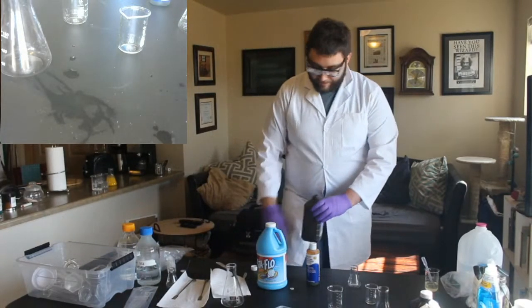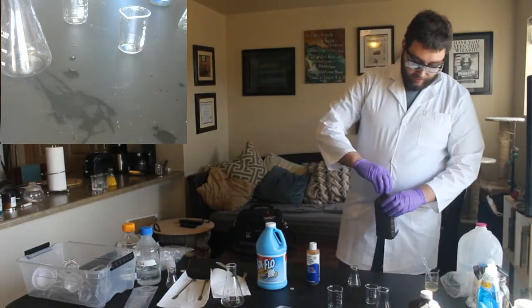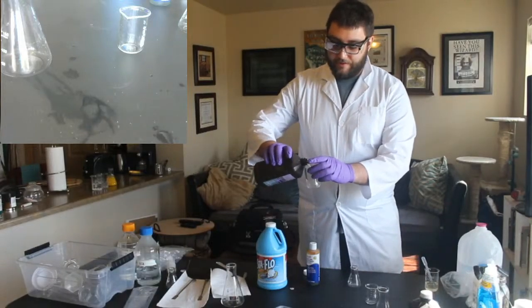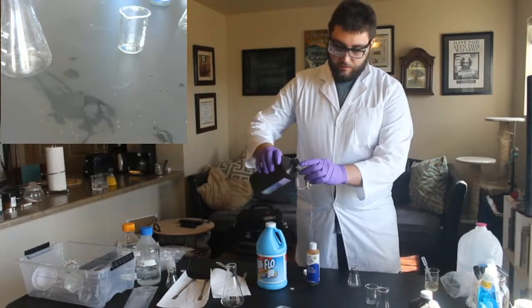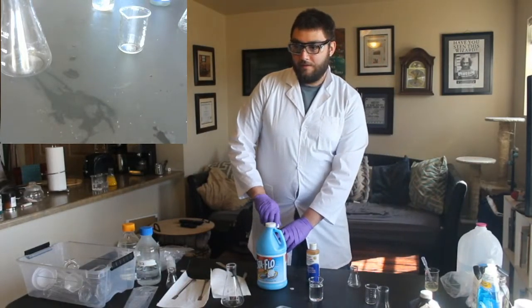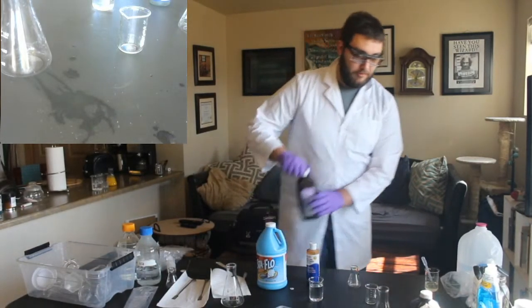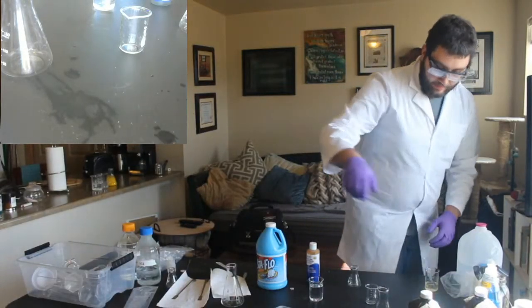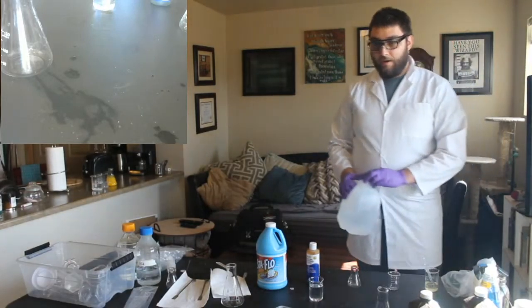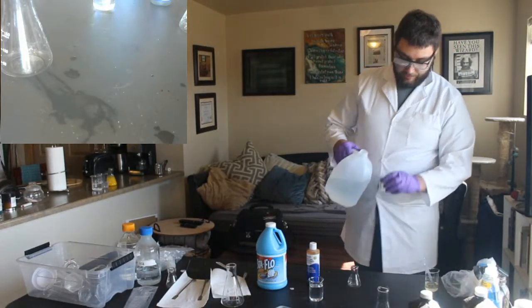Okay. But this is a fresh bottle. So the peroxide goes in this one. This is our starch one. And then, who can remind me, what do we need to put in our vitamin C one?